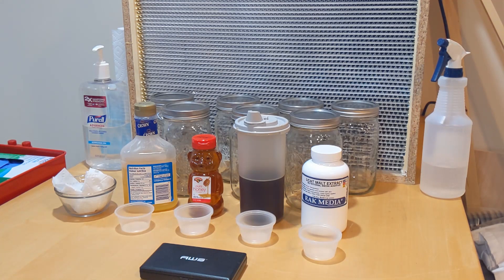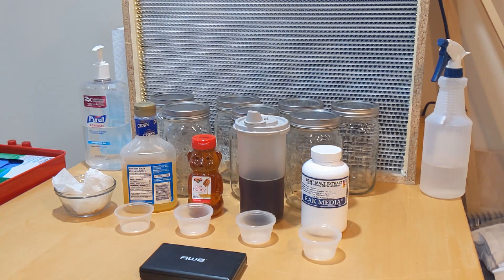I need to make some liquid cultures. I've got some very new exciting growths on agar that I would like to move into liquid cultures. So I thought this would be a great opportunity to go ahead and make a bunch of different ones and show you how I like to make those. So I guess I'll go in order of my favorite ways to make liquid cultures.